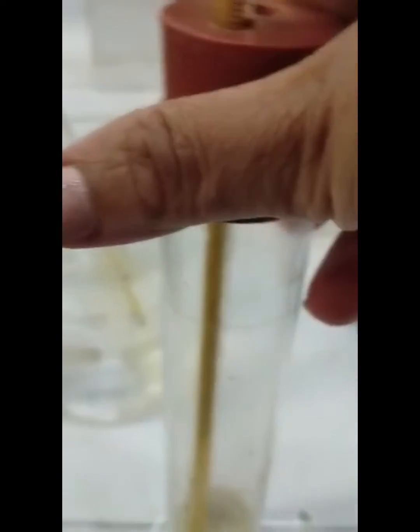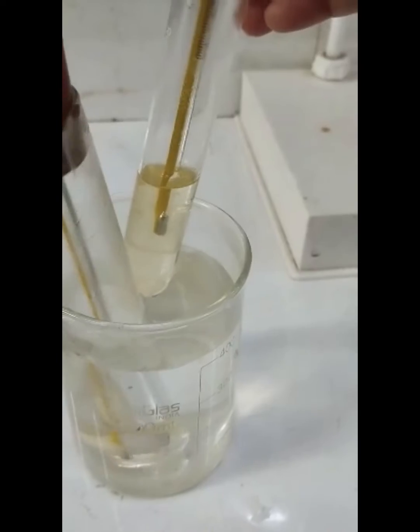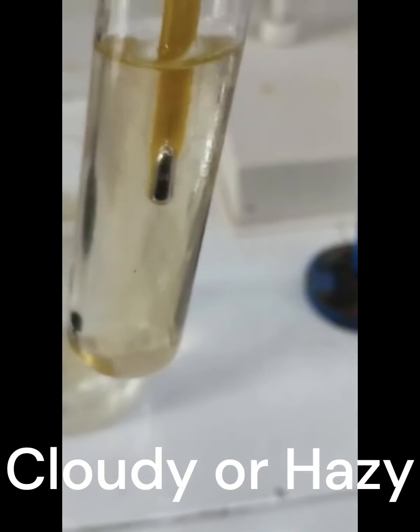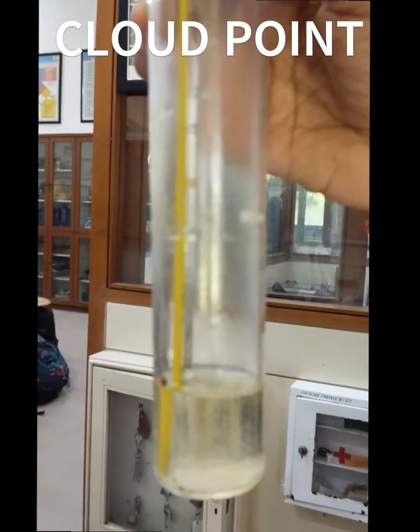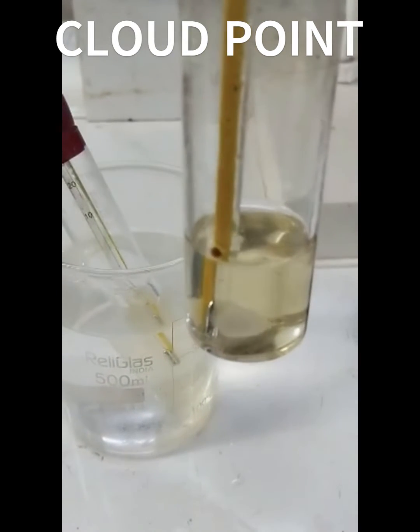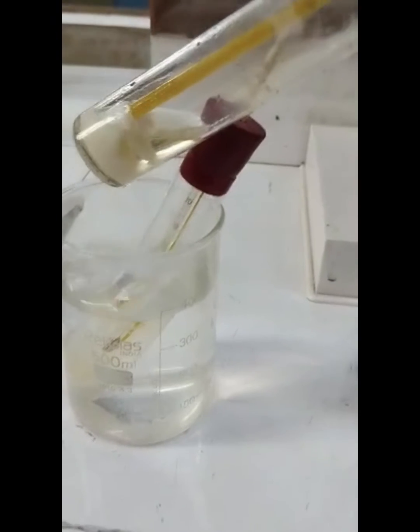You have to decrease the temperature. Meanwhile, you can use a round bottom glass tube as well — I have taken both a boiling tube and a flat bottom glass tube. After some time you will see a cloudy appearance, as you can see on the screen. This is what a cloudy or hazy appearance looks like when the temperature goes down. This temperature is referred to as the cloud point.